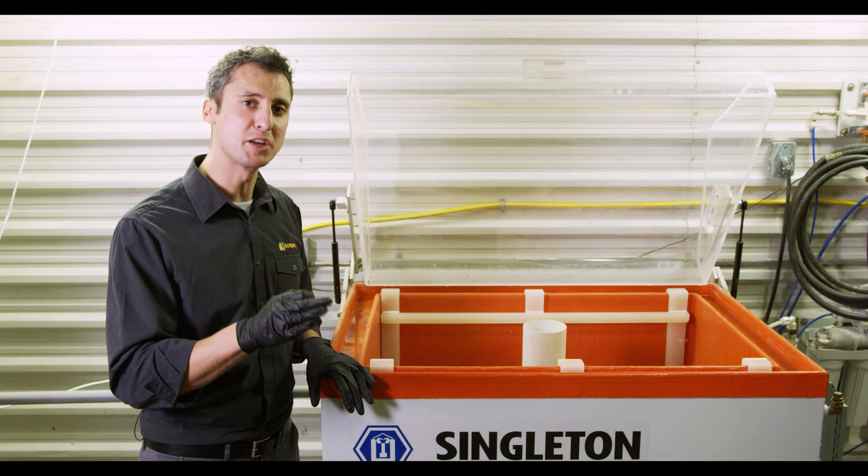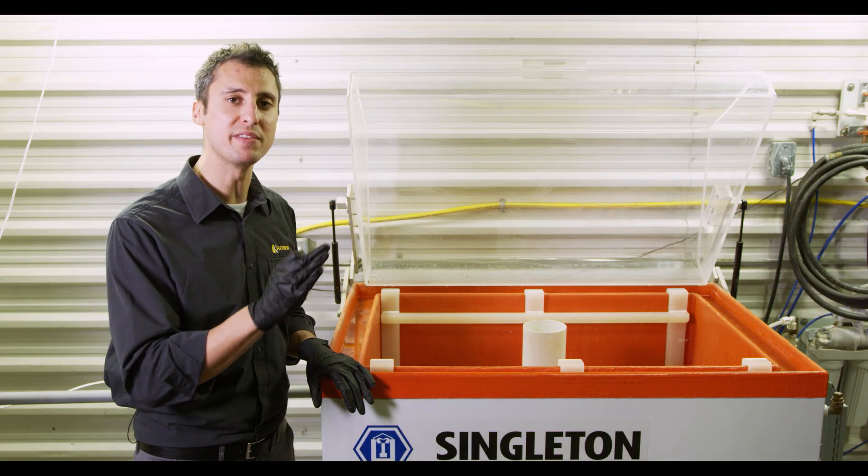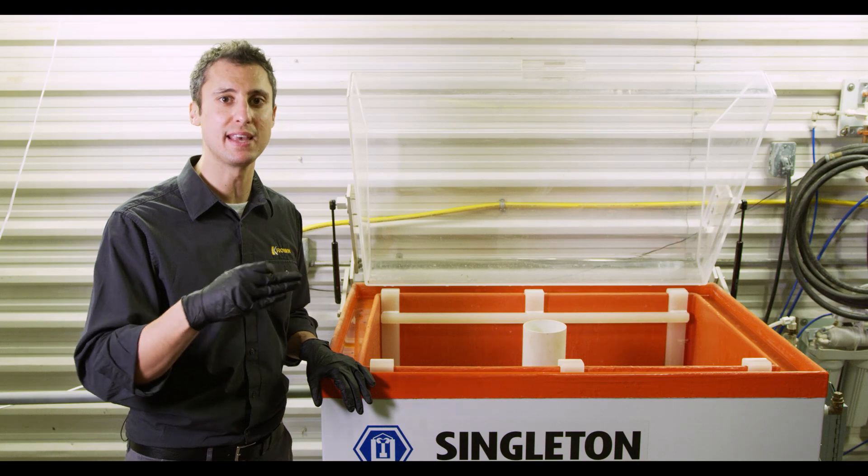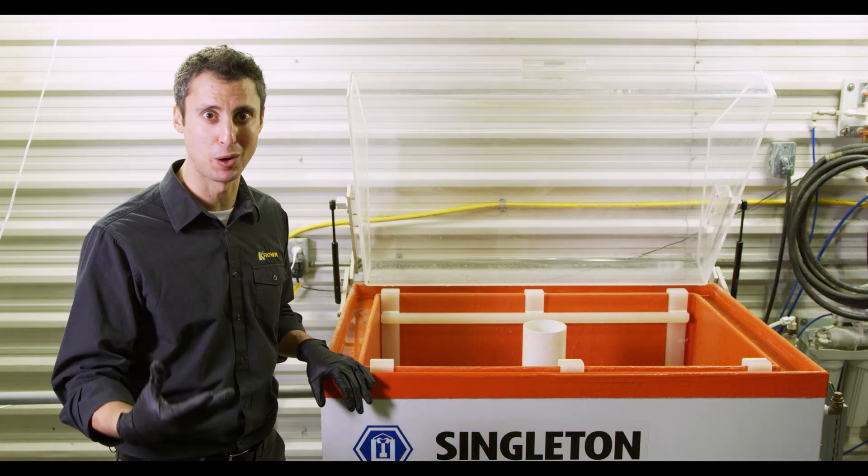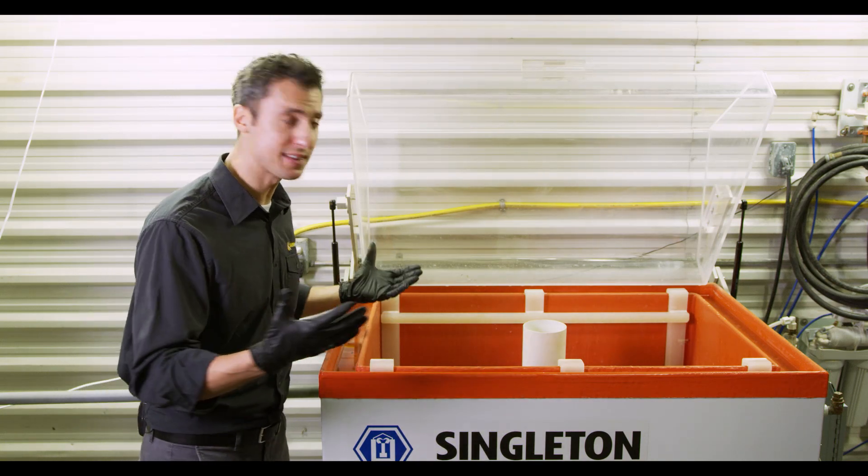The goal of this is to measure or see how long each one of these samples lasts before they begin to corrode or corrosion begins to form. So let's get our samples and let's get this test started.